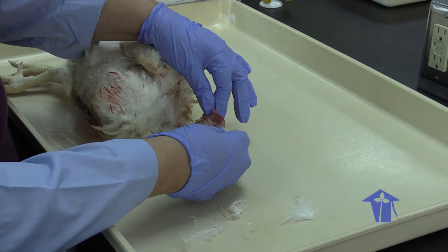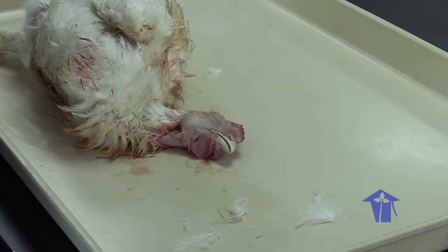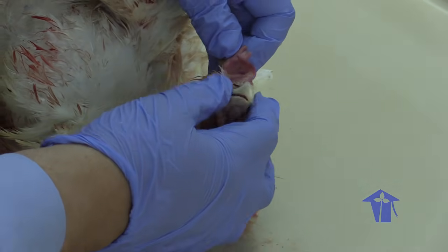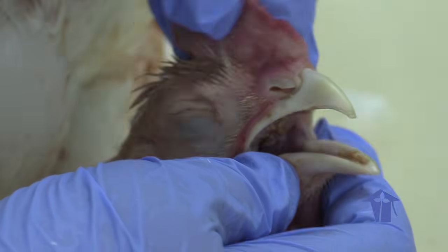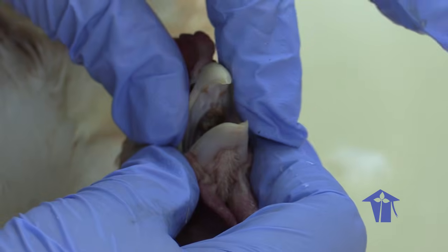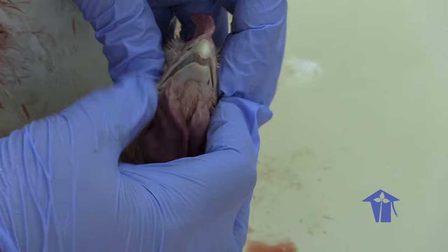Okay, so the first thing is we look at the mouth. I told you all that if you give me the head of any animal, I can give you a very easy, very precise guess as to what it ate, right? So this chicken's digestive system starts at the mouth. The beak is the first part of the digestive system. This beak is very sharp and curved, and what this chicken does is peck to pick up grains and small materials.